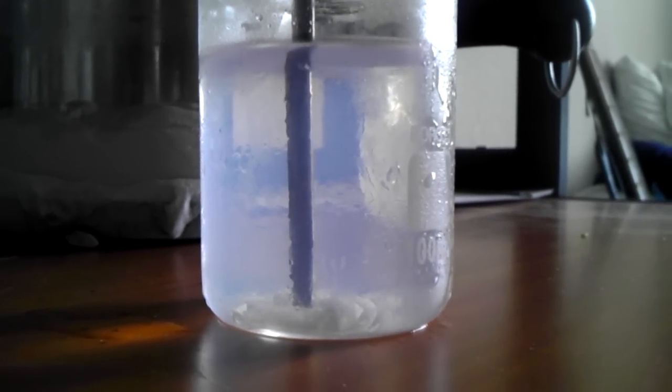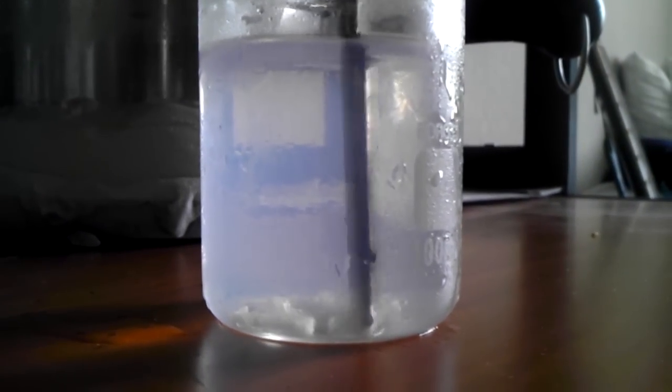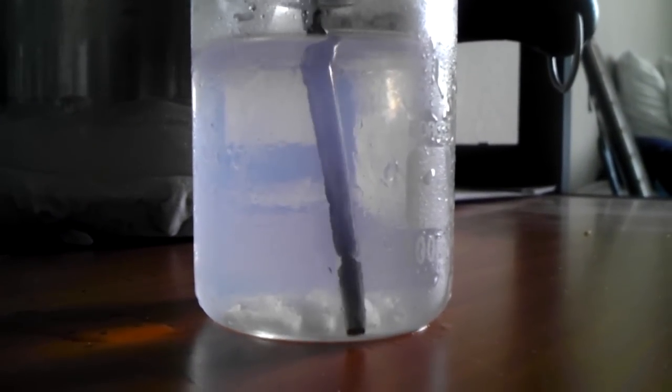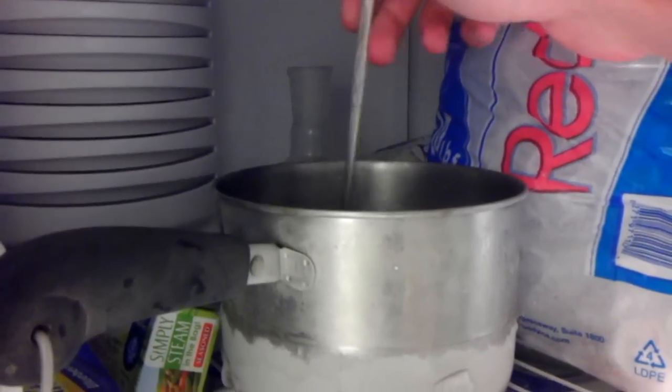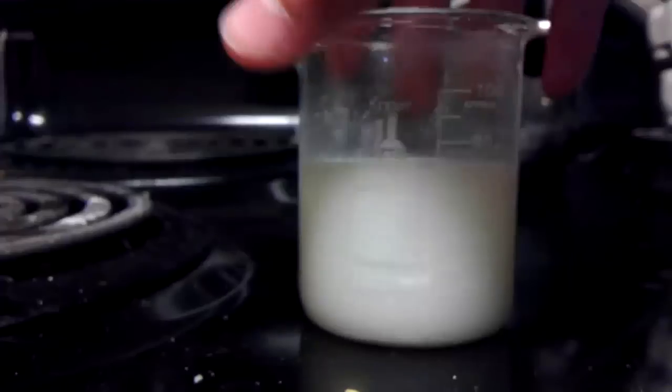Now, put it back in the fridge, stirring periodically every 30 minutes for two hours. Stir, stir, stir again, and stir one final time.